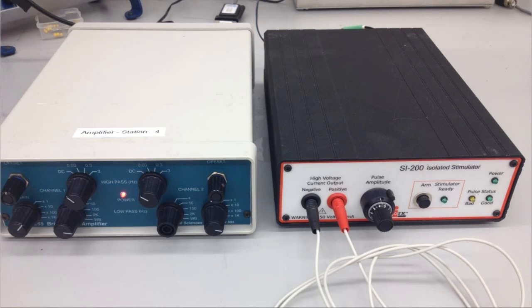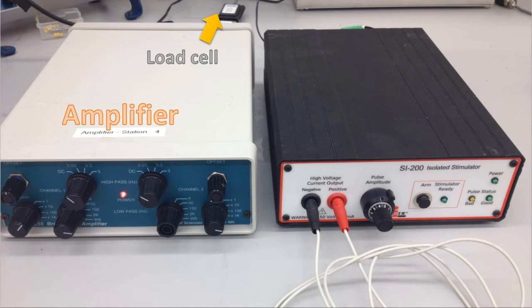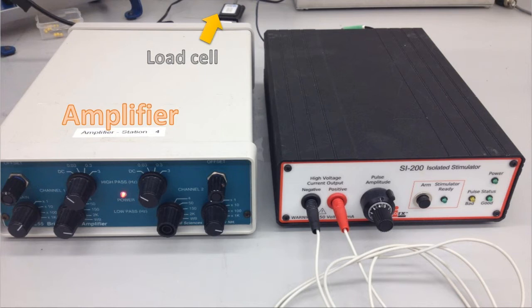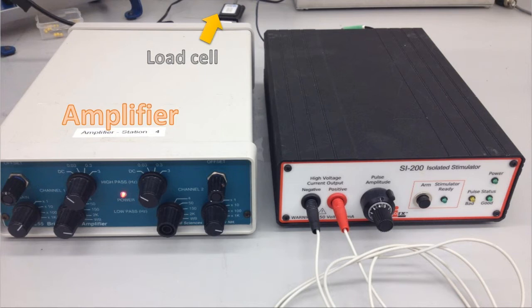For this module you'll be acquiring force data from a load cell. We're also going to need some new hardware to stimulate the frog sciatic nerve — that's the nerve that innervates the gastroc muscle. The load cell is the same type used for the smooth muscle response lab. Connect it as before through the amplifier. Make sure to have no high-pass filter, or have it DC coupled, and set a low-pass filter appropriate for the type of signal you expect.